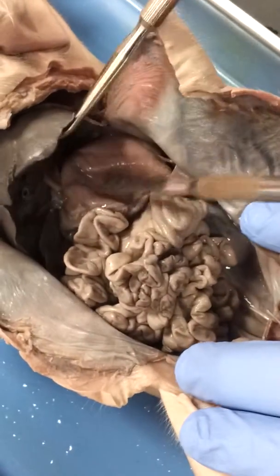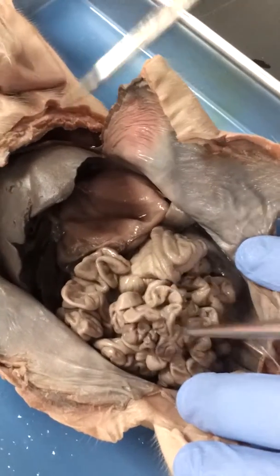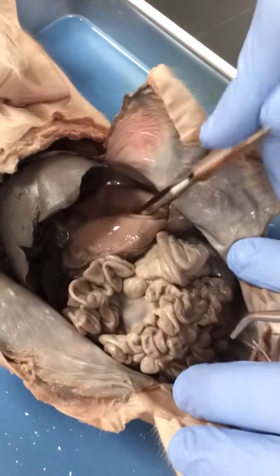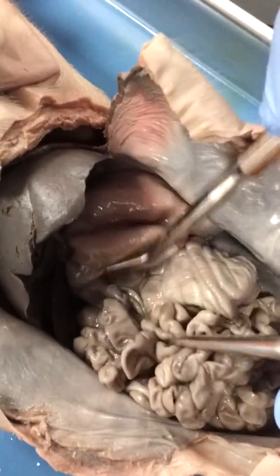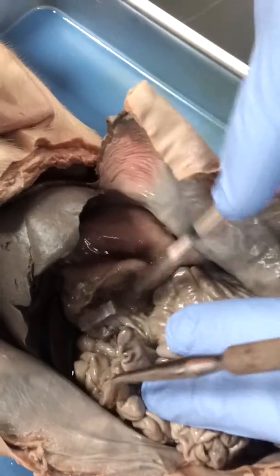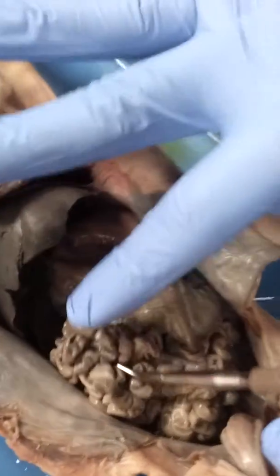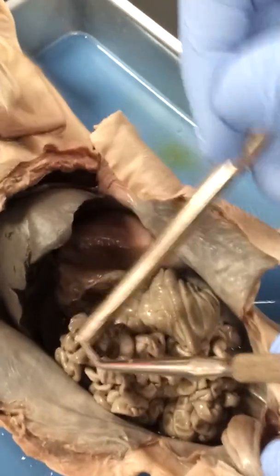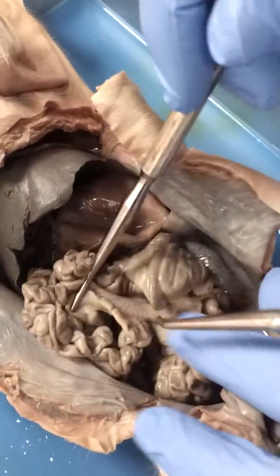Also, what's all along the digestive system is meconium, which is a green debris which aids in digestion. So we go on to the small intestine. The first thing that we have from the stomach and the pyloric sphincter is the duodenum, which goes into the small intestine. And the majority of the small intestine is the jejunum. Yeah, it's the bulge of the small intestine, the top bulge. And then we go into the ileum, which is almost the end of the small intestine.